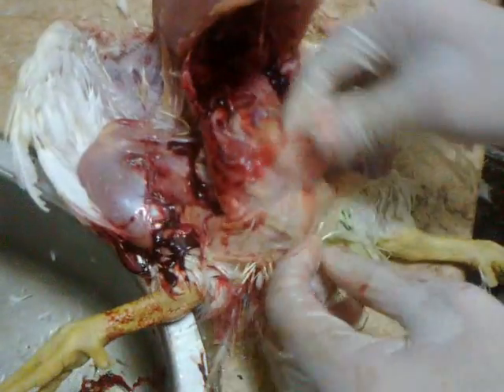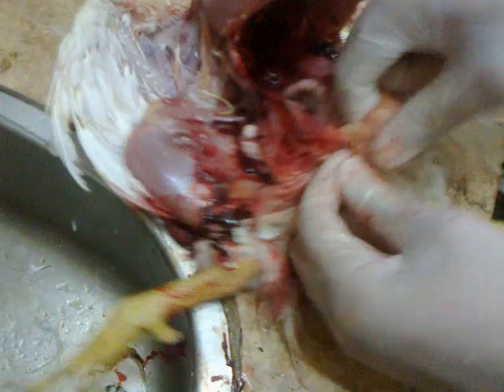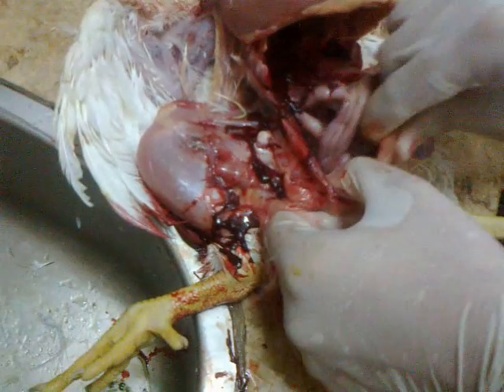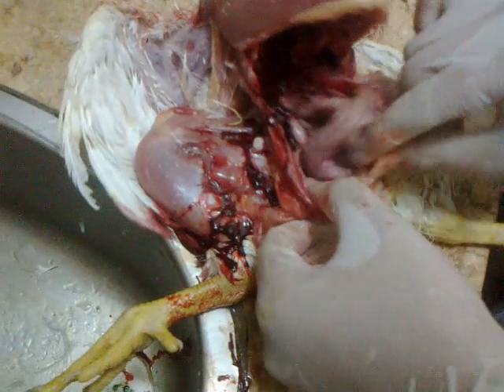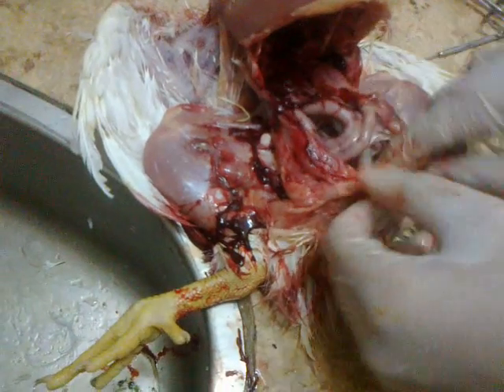Here, dorsally to the cloaca, you should search for the bursa of Fabricius, which is the rosette shape.